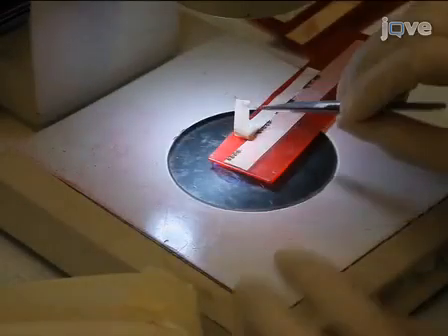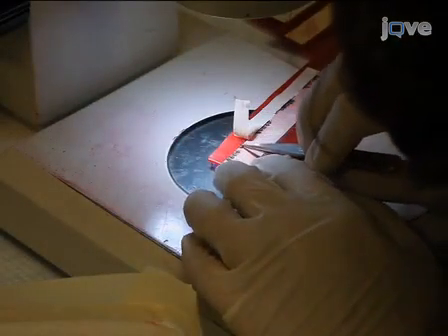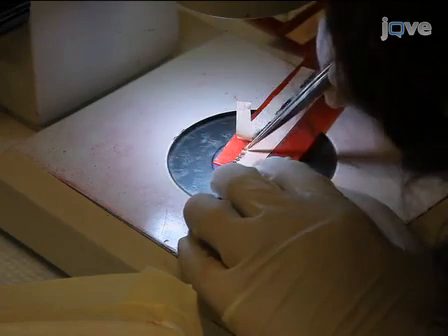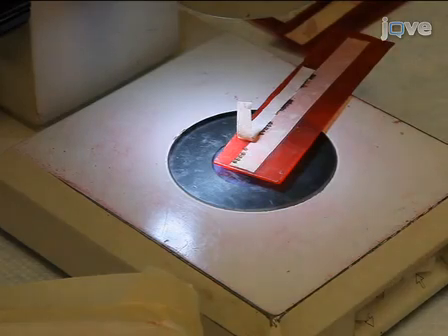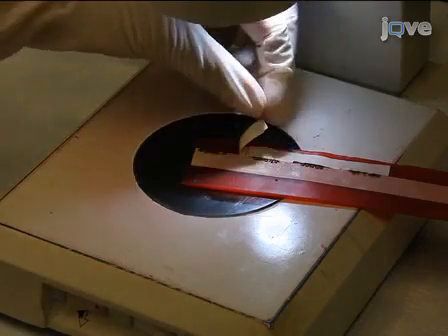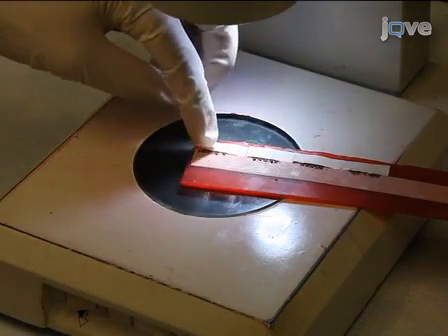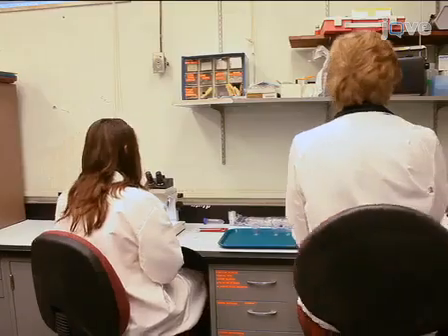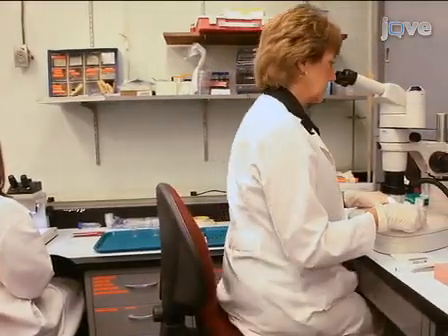To begin the tick injection process, capture a tick using Dumont fine forceps and place it ventral side up on double sticky tape affixed to the sheet of red dental wax. Closely position the ticks into groups of 5. Place a small strip of masking tape over the mouth parts of all 5 ticks in order to further restrain them. Leave most of the body exposed so that the injection process can be observed by the tick injector.